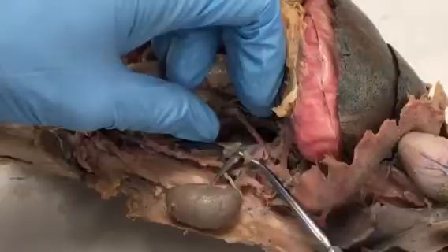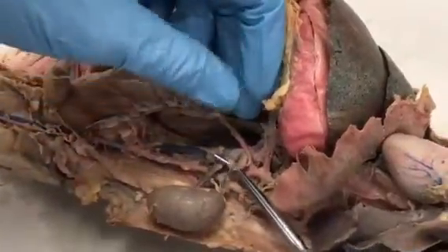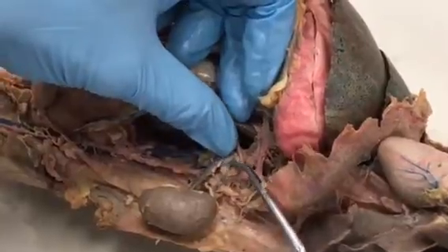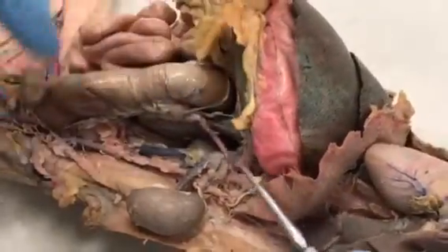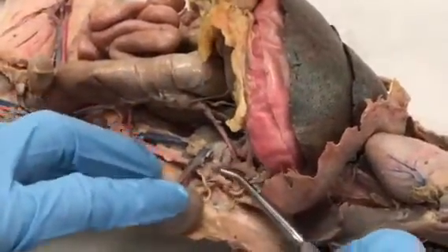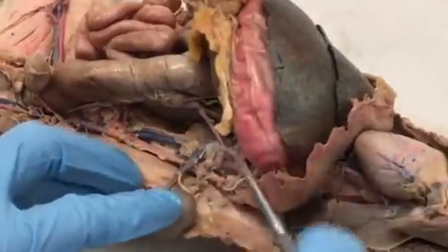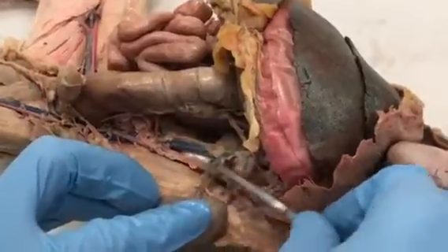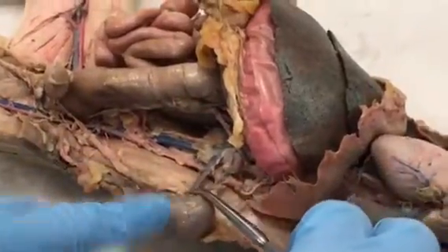So now descending into the abdominal cavity, we can follow the postcava on down. The first vein we're going to see that's on our sheet is the Adrenolumbar Vein, and it services this little gland right here called the adrenal gland. The next vein we're going to see, and this is the left Adrenolumbar Vein. There's one on the right side as well. The next vein we're going to see, in this case, is the left renal vein, and it services the kidney.